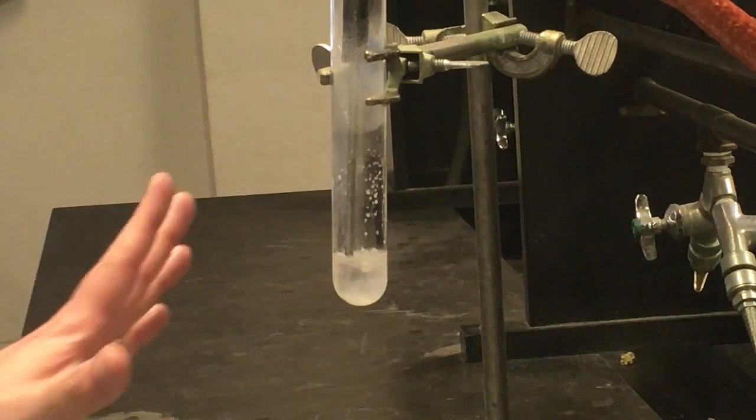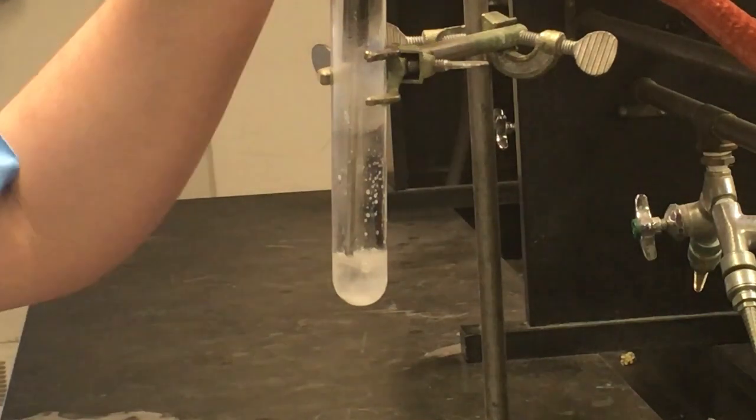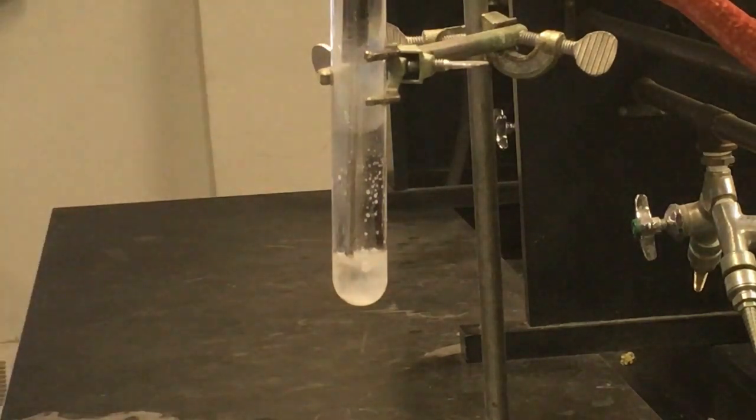All right, so it looks like this is pretty much frozen solid now all the way through. There's maybe just a tiny bit of liquid still left in it, but it's almost solid all the way through. So I'm going to cut off this portion of the image here, and in just a second I'll show you the plot of the data on the LabQuest again, along with all the measurements for this portion of the lab.